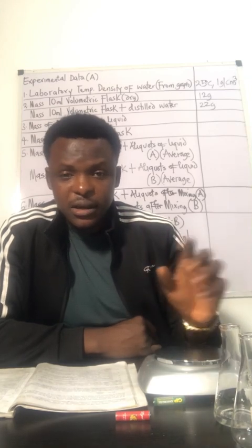Okay, welcome back. We're going to be looking at procedure 3. Under procedure 3 is determination of the density of a second liquid. In this experiment, we're going to be making use of two liquids. The first one is water, which is assigned a symbol of A. The second liquid in this case is ethanol.